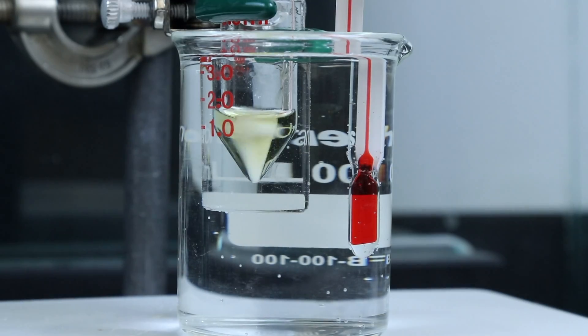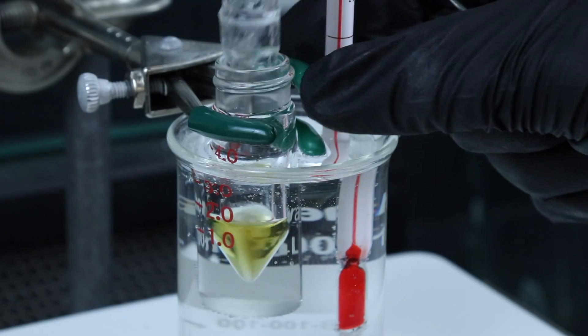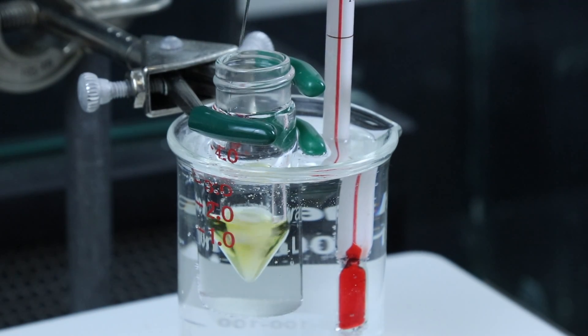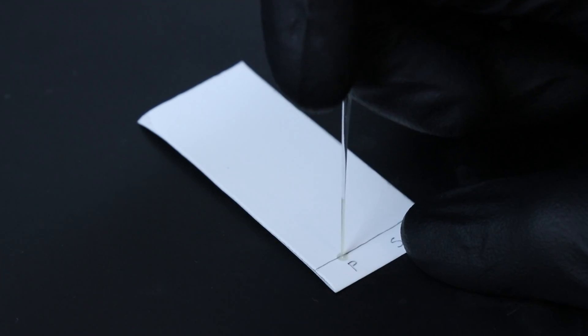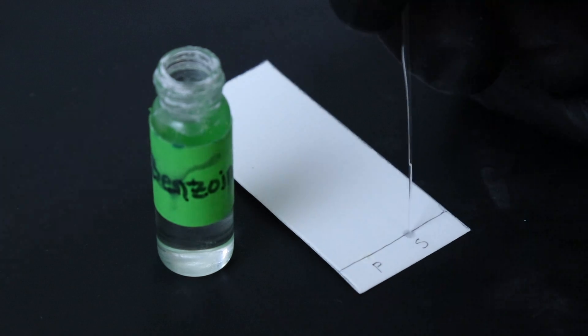Now I'll let everything react for about an hour after which I'll get some of the solution out and spot a TLC plate with it making sure to also spot that same TLC plate with a standard of the product.